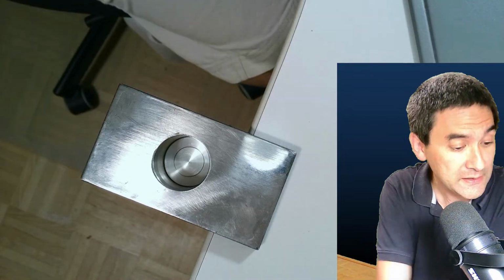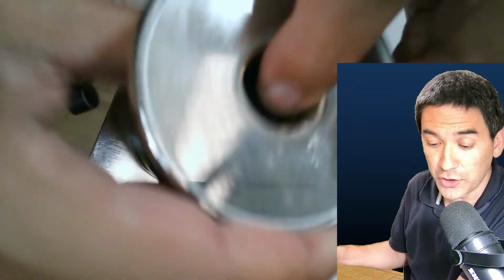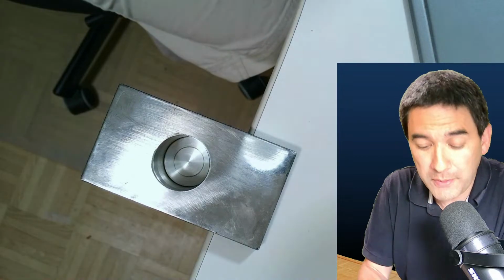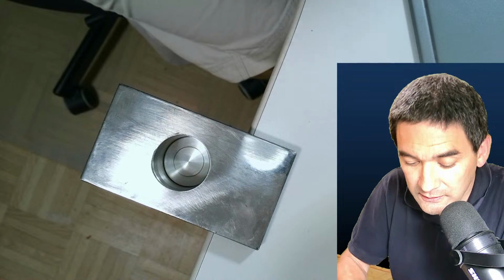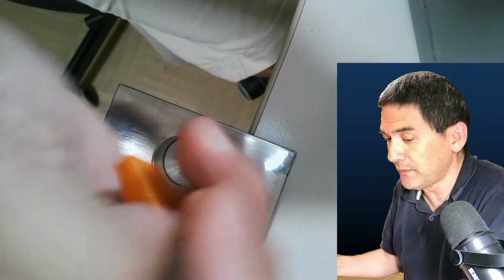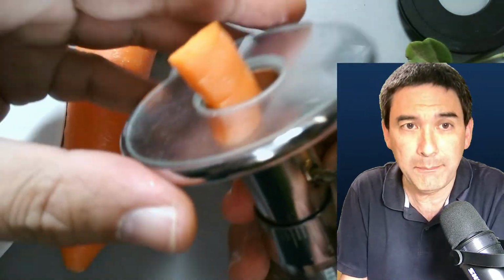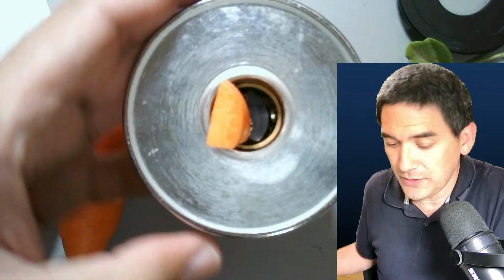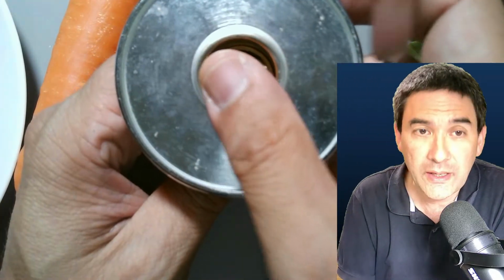And this also explains a little bit the advantage of those microtomes that have a clamp, okay? Like the one over here. However, there is another problem with this, which I would also like to show you. I'm going to prepare another carrot, okay? You're not seeing this right now. Okay, so this is the carrot, and I'm just going to move this back for now, and when you put it in here, and tighten the clamp, and cut across, I always have to be careful, glass surface is on here.